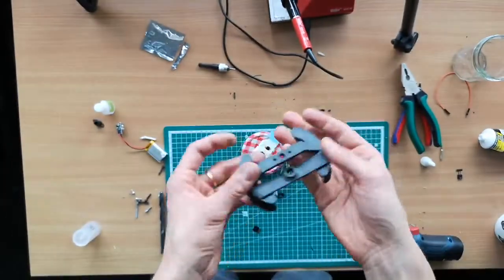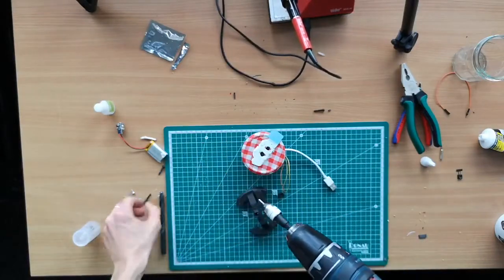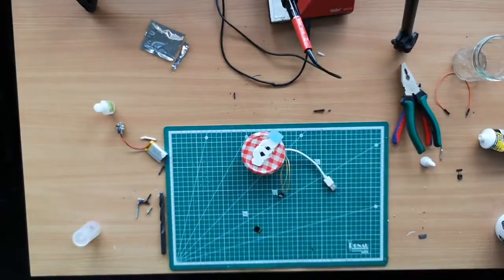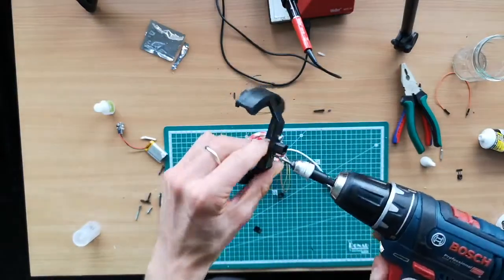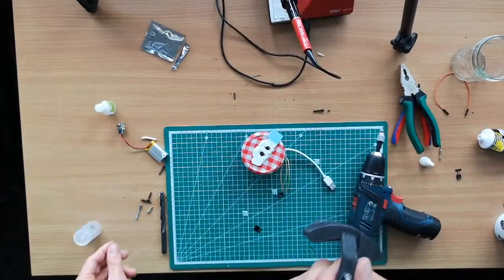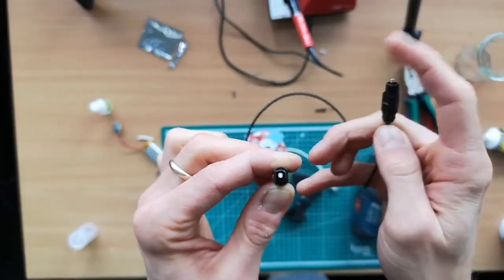So this is the part for the illumination, and only two things have to be done. We have to mount the Toslink adapter. For this we need again some M3 screws. So we put them through the holes and add the part here. With this we can then also add the Toslink cable. The Toslink is a fiber that's used for optics, for audio. And what I'm doing right now is just blocking it.